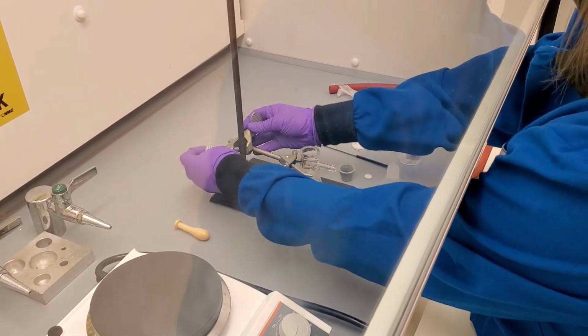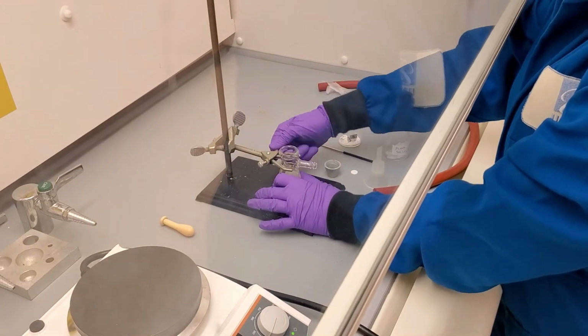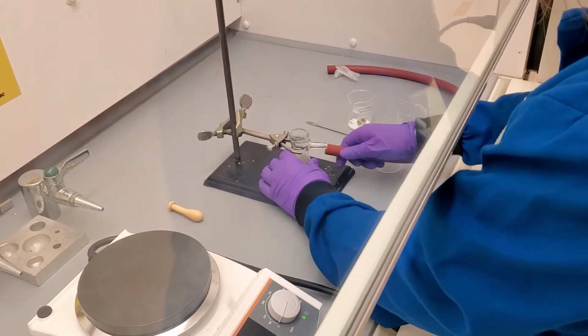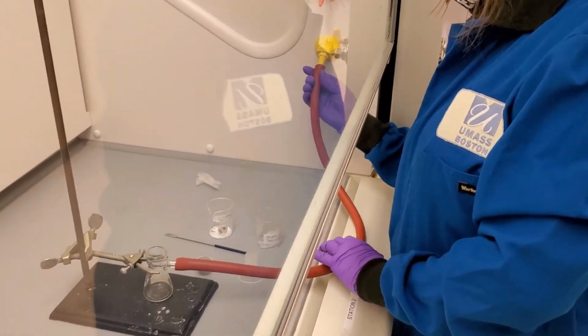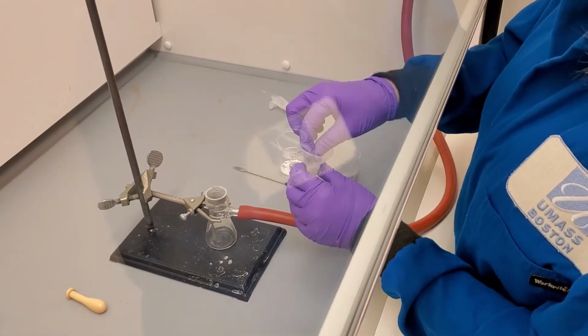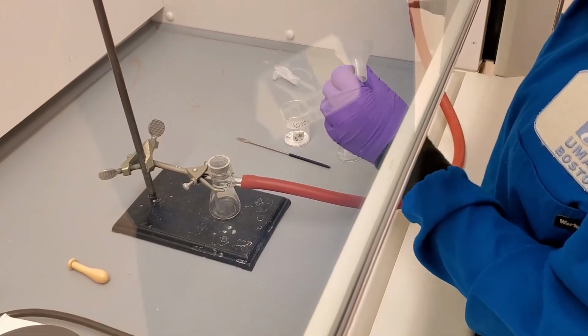acid while we wait. First, we prepare the filtration setup so that it is ready when we are done with the recrystallization. As before, clamp the filter flask to the ring stand. Attach the hose to the flask and the vacuum nozzle. Place the neoprene adapter in the neck of the flask. Place the filter in the Hirsch funnel and place the funnel in the neoprene adapter.